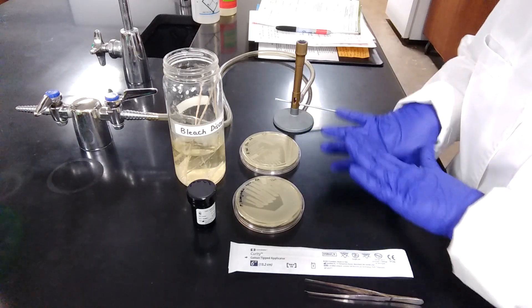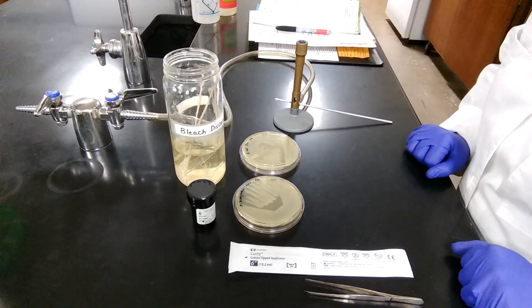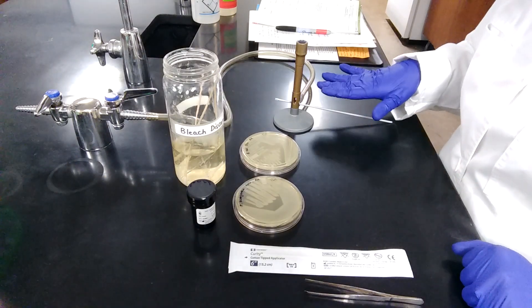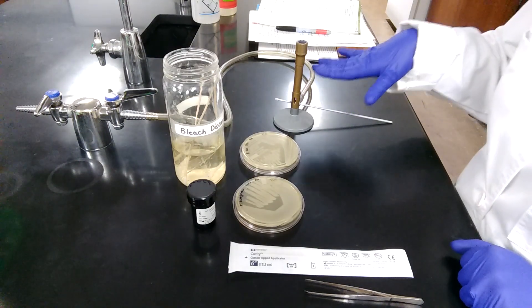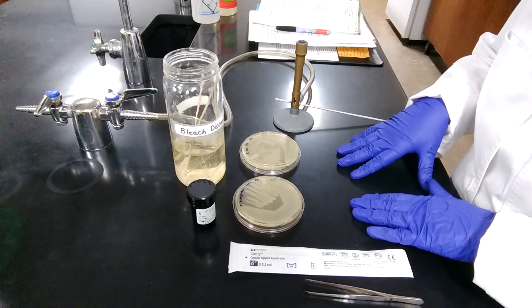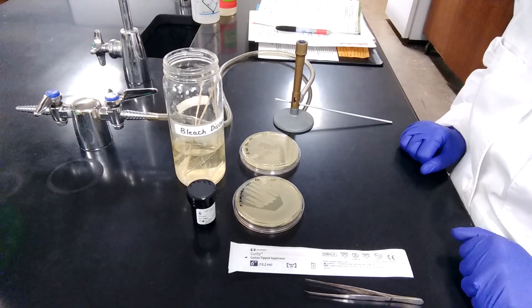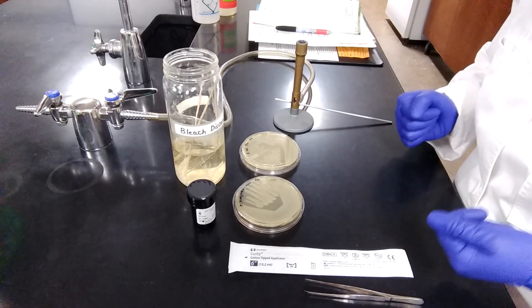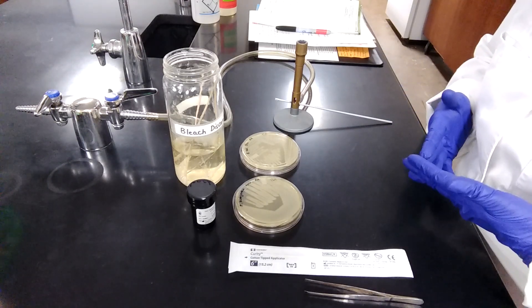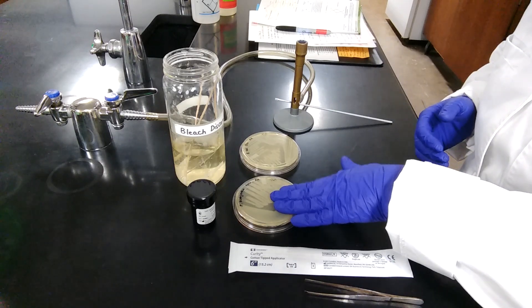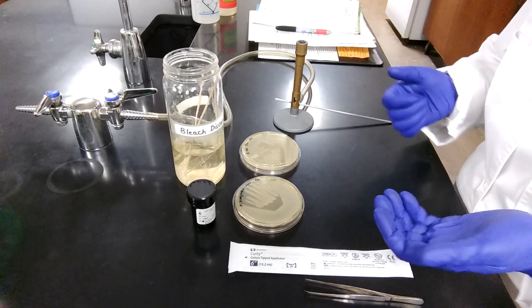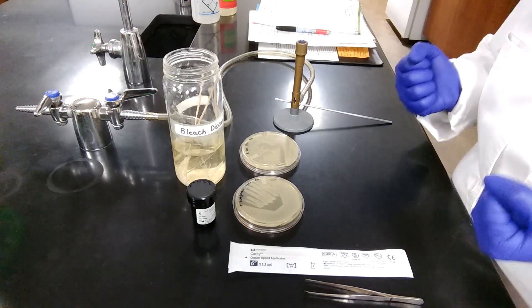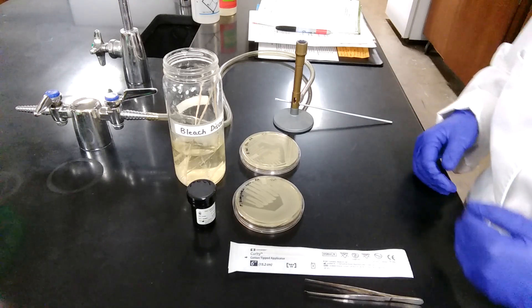The experiment should be conducted aseptically, and the procedure should be conducted within the sterile zone. As you can see, I have the burner going, and I will be conducting the experiment within the sterile zone around the burner. Also, you should be wearing full lab PPE to conduct this experiment, as we have a BSL-2 bacterial species here for this experiment. The PPE includes gloves, safety goggles, and lab coat.